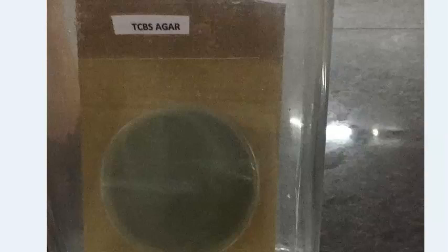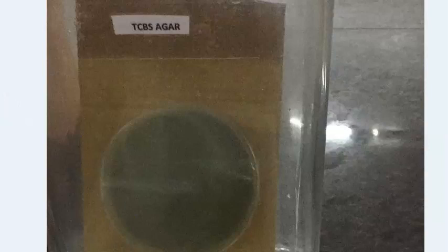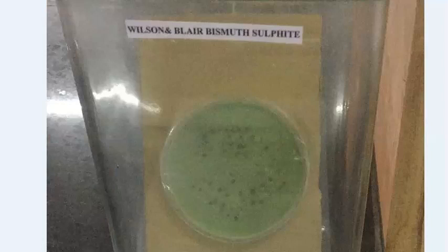TCBS — thiosulfate citrate bile salt sucrose agar — is a selective media for Vibrio. Sucrose-fermenting bacteria like Vibrio cholerae form yellow colored colonies. If an organism ferments sucrose it gives yellow colonies; otherwise colonies remain green.